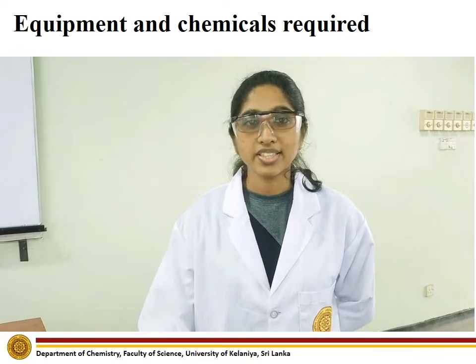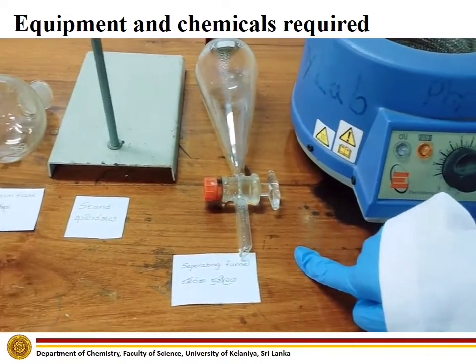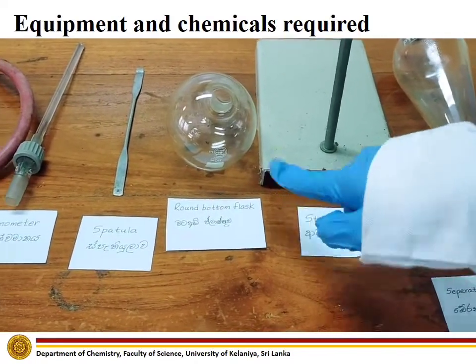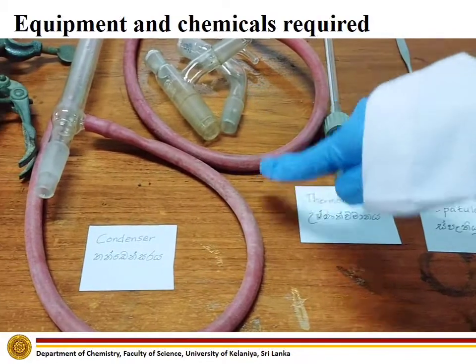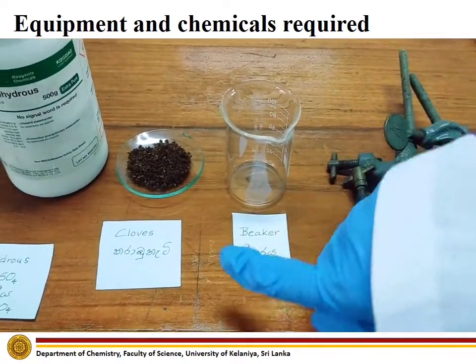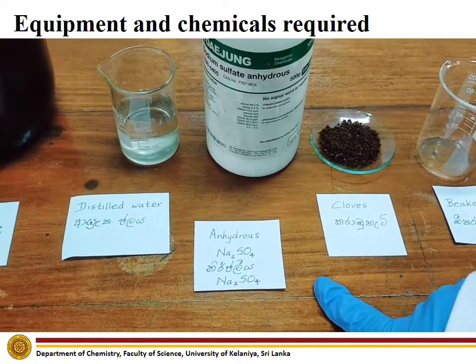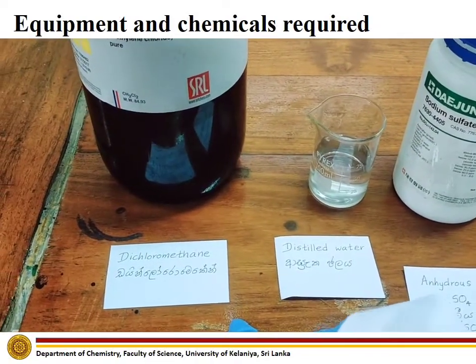Chemicals and equipment required to carry out this experiment include: heating mantle, separating funnel, stand, round bottom flask, spatula, thermometer, condenser and distillation setup, clamps, beaker, about 5 grams of ground cloves, anhydrous sodium sulphate, distilled water, and dichloromethane.